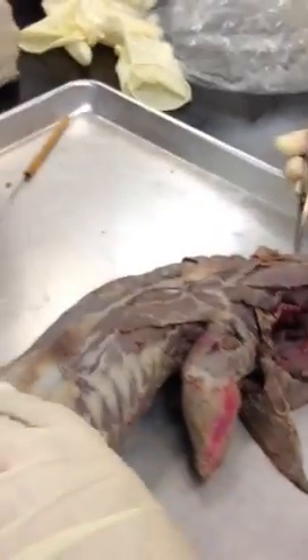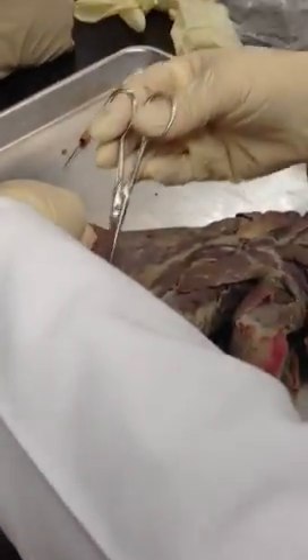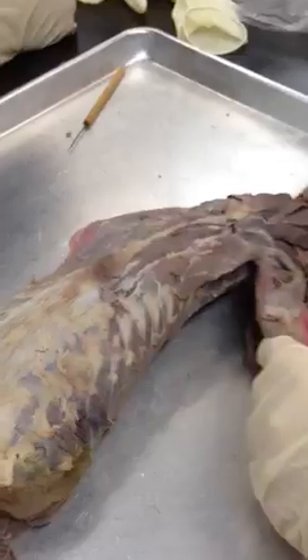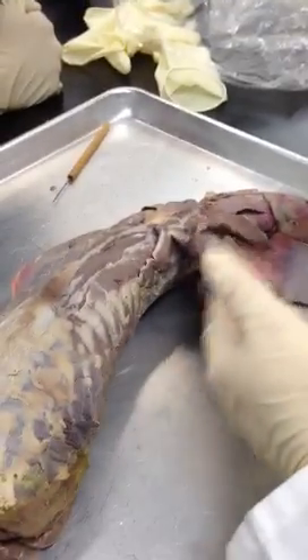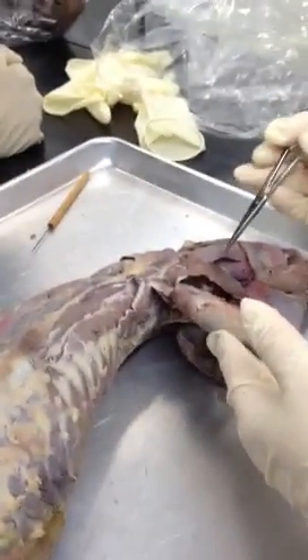That's kind of the big muscles. Also here — external oblique, like we saw. On the other side, this is latissimus dorsi — pretty big there. To free up the arm, I totally cut away the latissimus dorsi. And on the front side, you cut pec major and minor — that allows the arm to move freely so you can see things much easier that way. That's the difference in techniques — you can see the arm muscles a little easier.